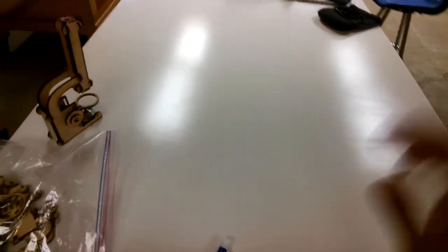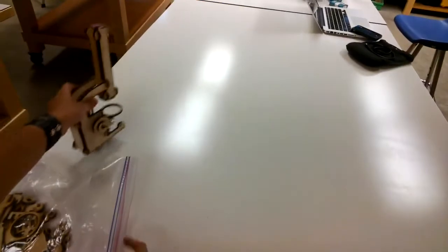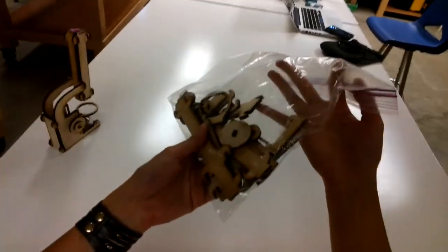Hi everyone, this is Miss Chow and I'm going to show you in this video how to assemble your own microscope so that you'll have something like this, and you're each going to get a kit from Miss Nawa's, something like this.